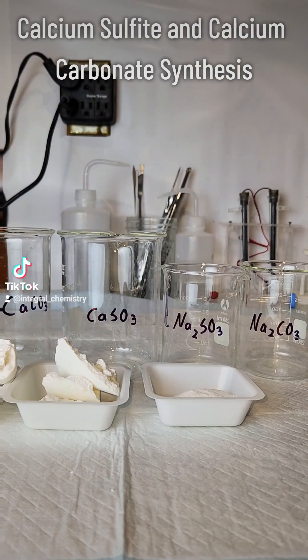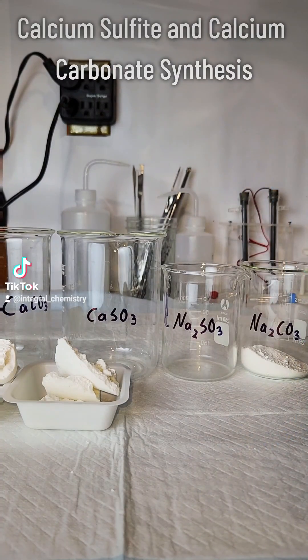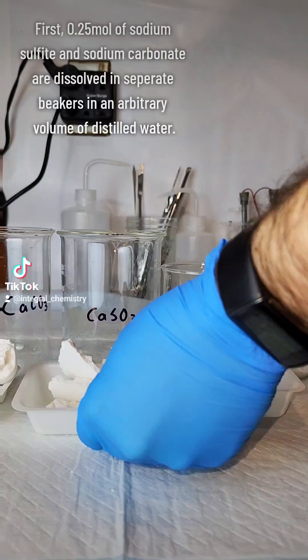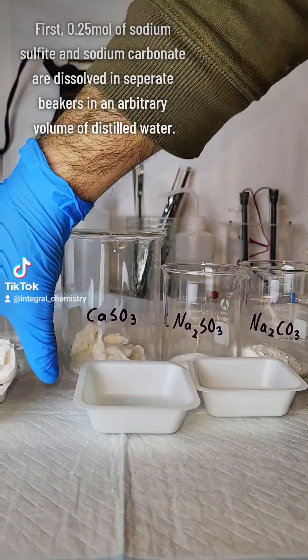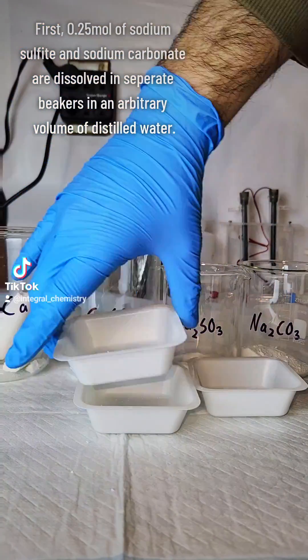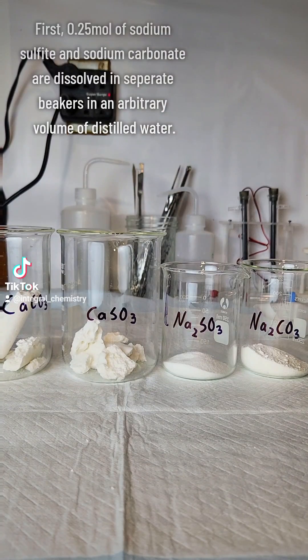I've gotten a lot of requests to demonstrate how I make calcium sulfite, since it's not really something you can buy. On that note, today I'm going to demonstrate how to make calcium sulfite and calcium carbonate, since the synthesis is about the same.